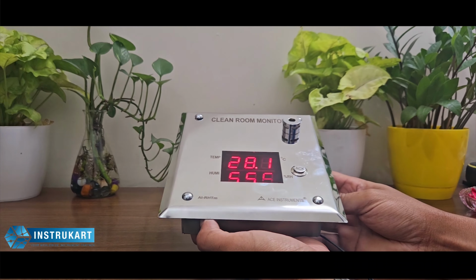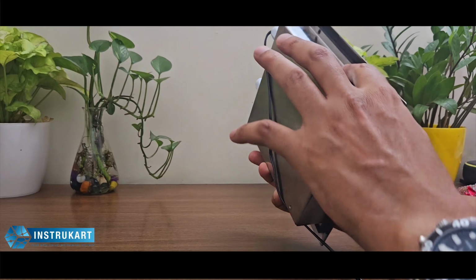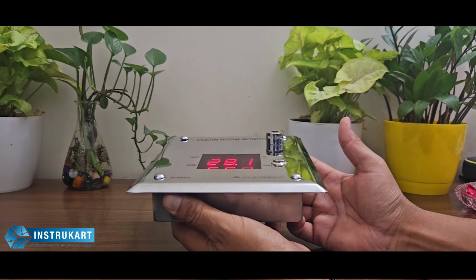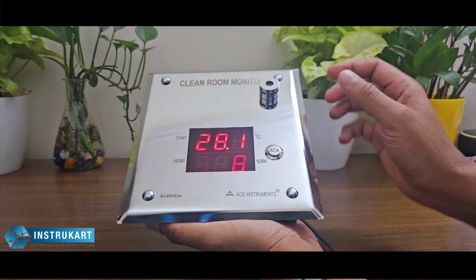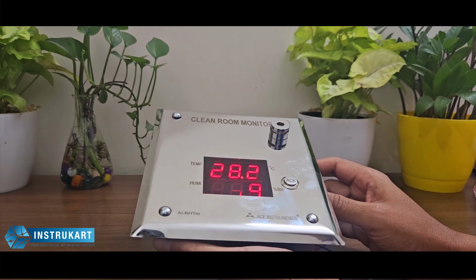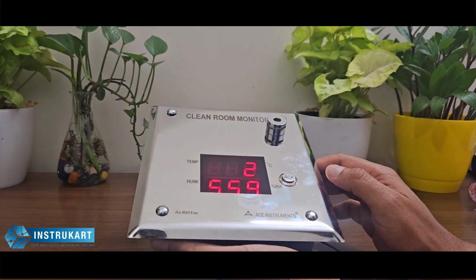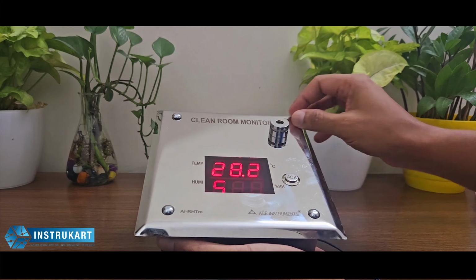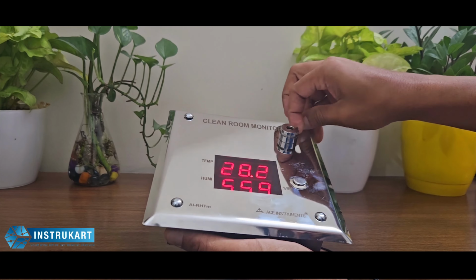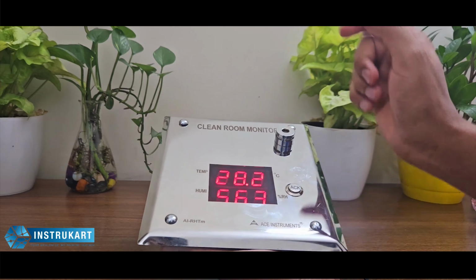This is a modular wall panel mounting or panel fitting. So it goes like a flush. The weight is approximately 1 kilogram, and it has got 4 buttons inside to do several settings like the temperature and humidity, low and high set points, offsetting, and the password protection also. To do that, you might have to open these caps from the top, these 4 caps, and then you have to use the buttons to do the settings.